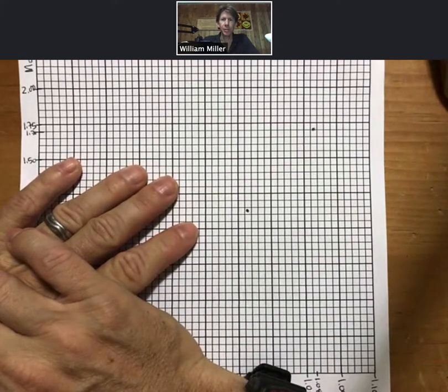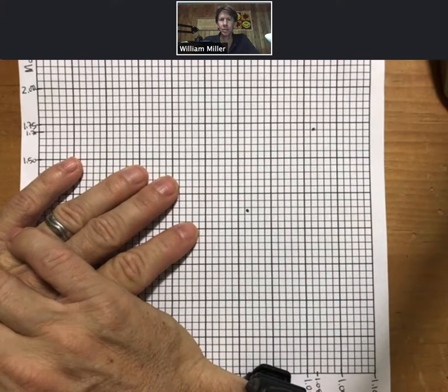This is experiment three, density of saline solutions, making a best fit line by hand.